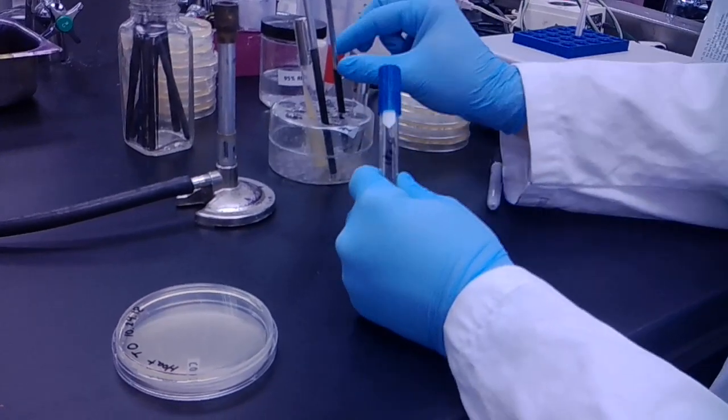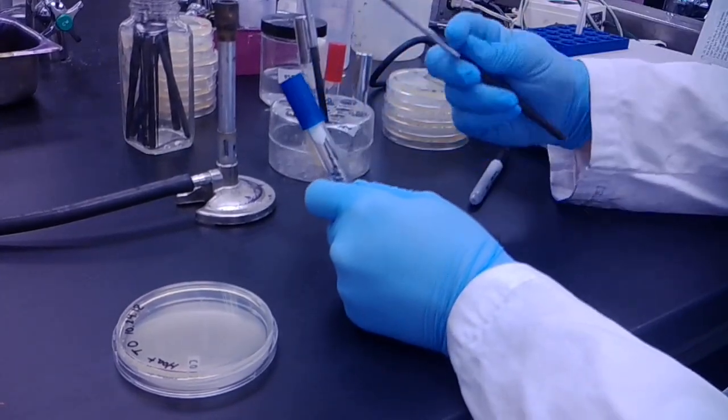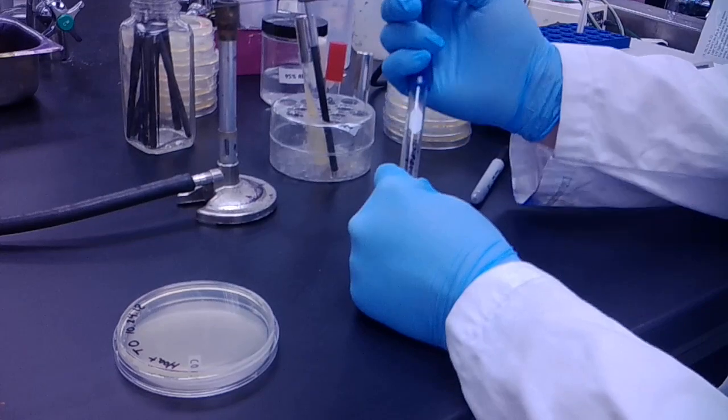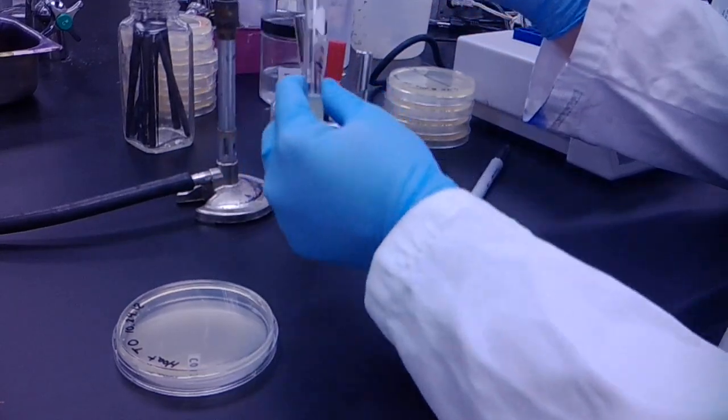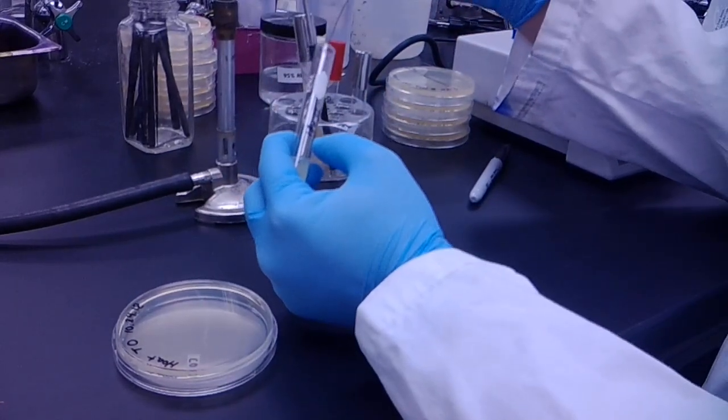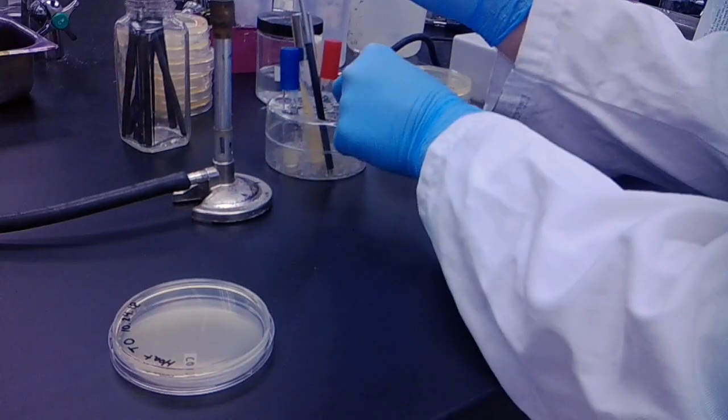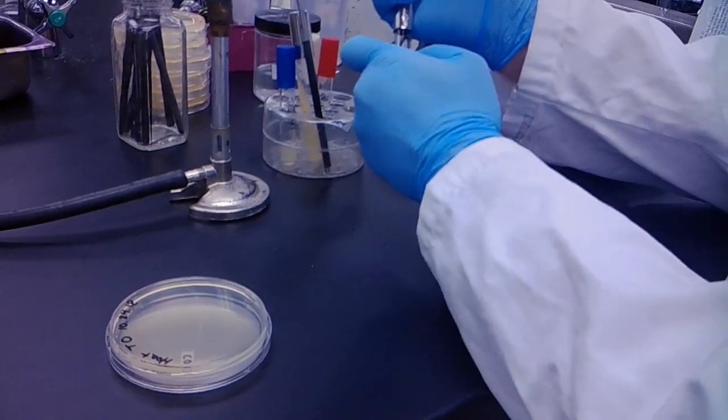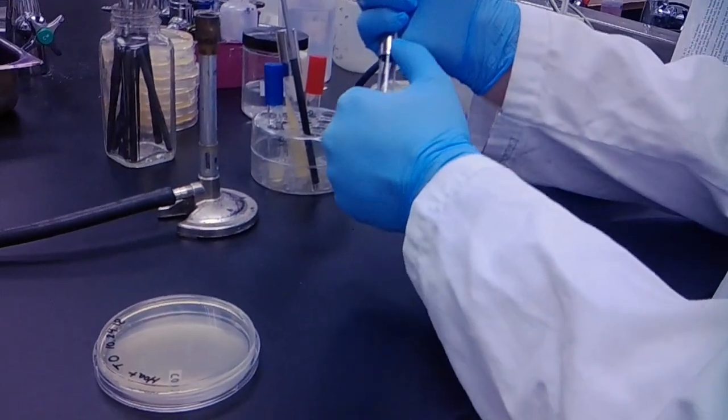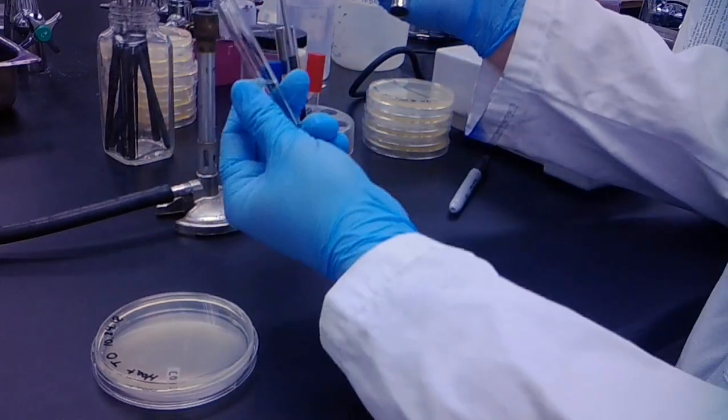I'm going to take my sterile loop and take up some S. epidermidis from broth and then inoculate my sterile media.